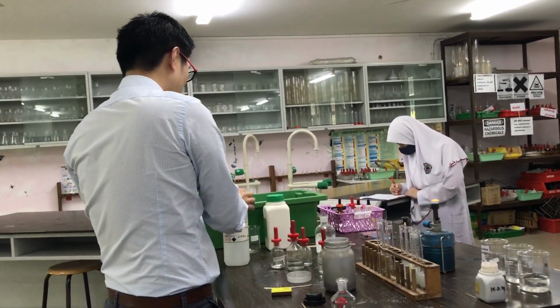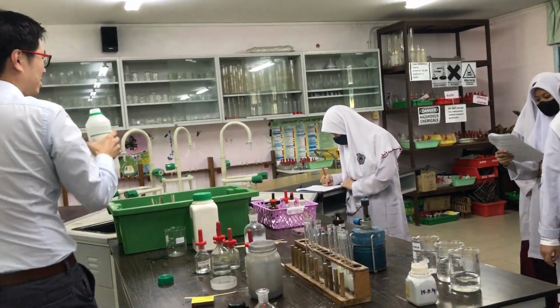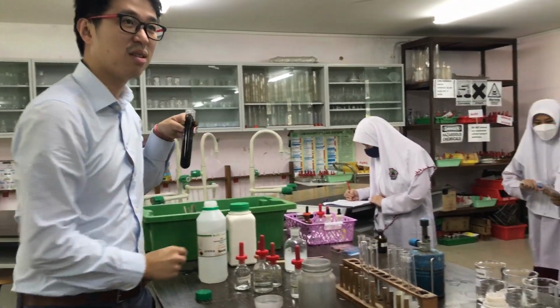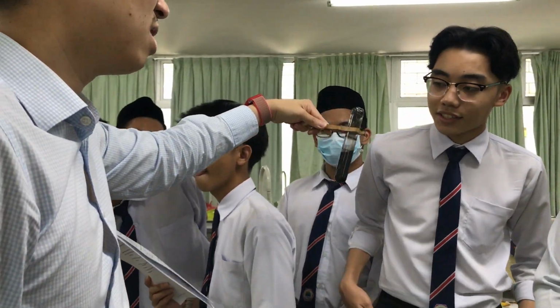I think the reaction is finished. It's quite fast, yeah? And I'm going to add some more peroxide. Catalyst, how do you spell the word catalyst? C-A-T-A-L-Y-S. Come, you can probably hear it now. You can see the bubbles, right? Can you hear it? Yes.